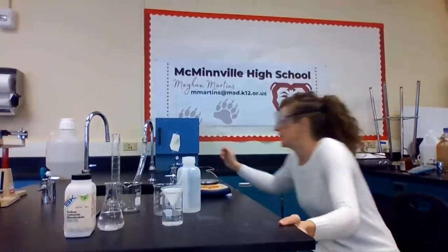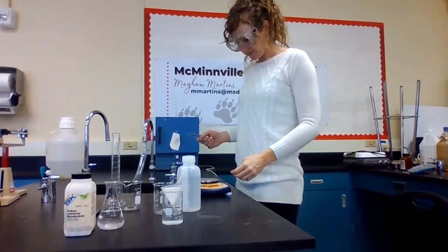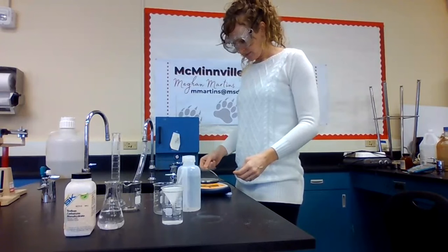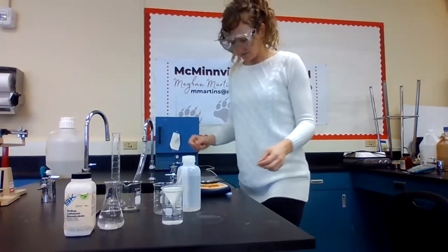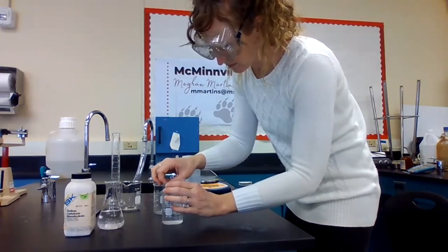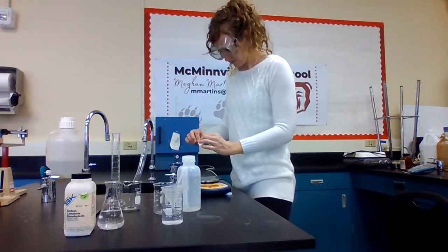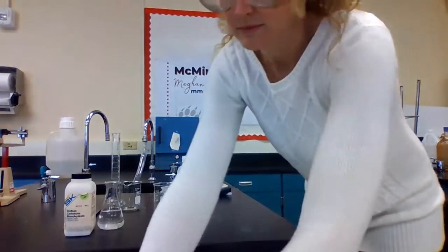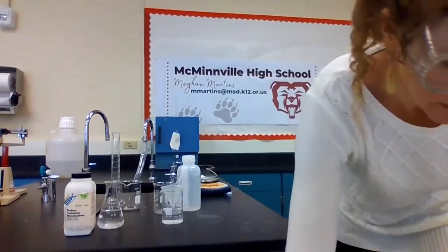So let's get an initial weight. .4 grams.